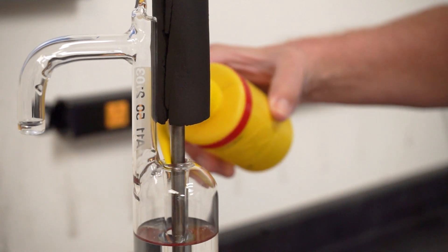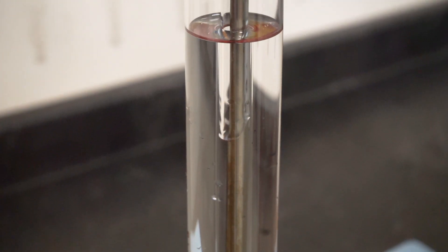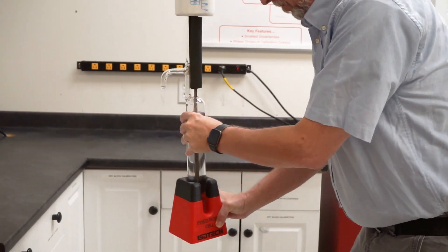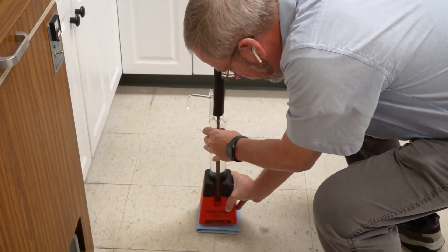While the mantle maker is inserted, slowly fill the area between the mantle maker and the inner cell with 99% isopropyl alcohol. Now that you have inserted the alcohol, place the entire assembly on the floor so you can fill the device with liquid nitrogen.